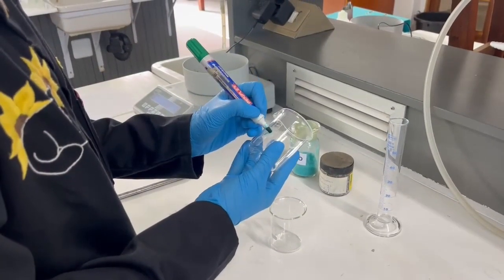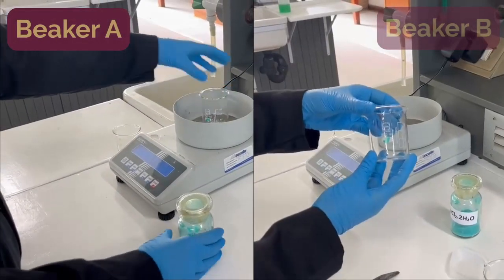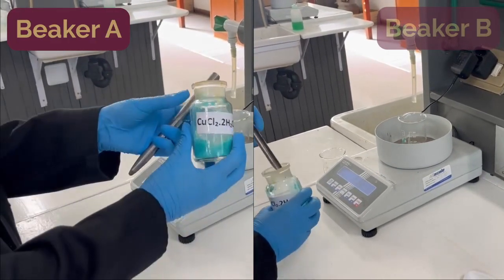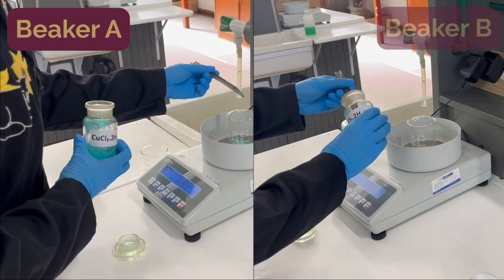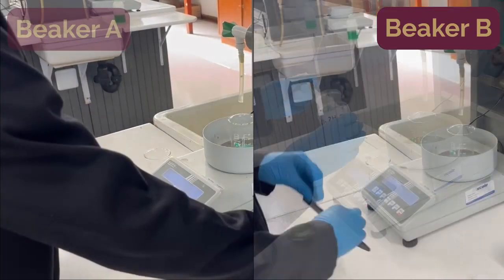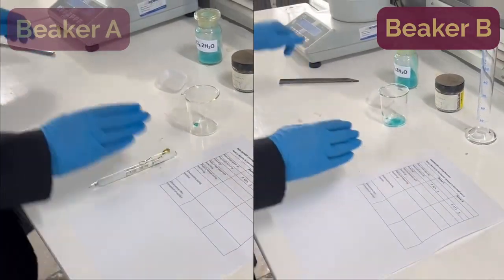Label one 250 cubic centimeter glass beaker as A and the other beaker as B. Weigh approximately 0.50 grams of the hydrated copper chloride directly into beaker A. Record the mass of the hydrated copper chloride in the data report table. Then weigh approximately 0.70 grams of the hydrated copper chloride directly into beaker B. Again, record the mass of this hydrated copper chloride in the data report.